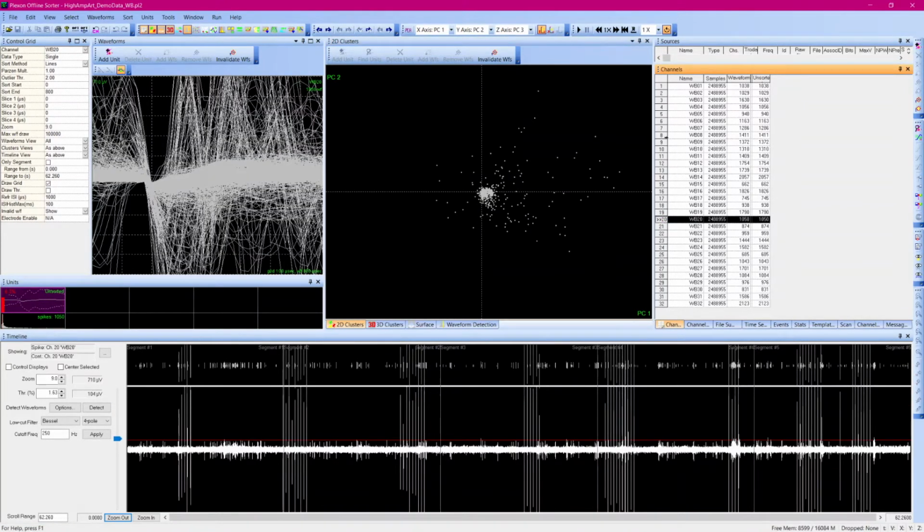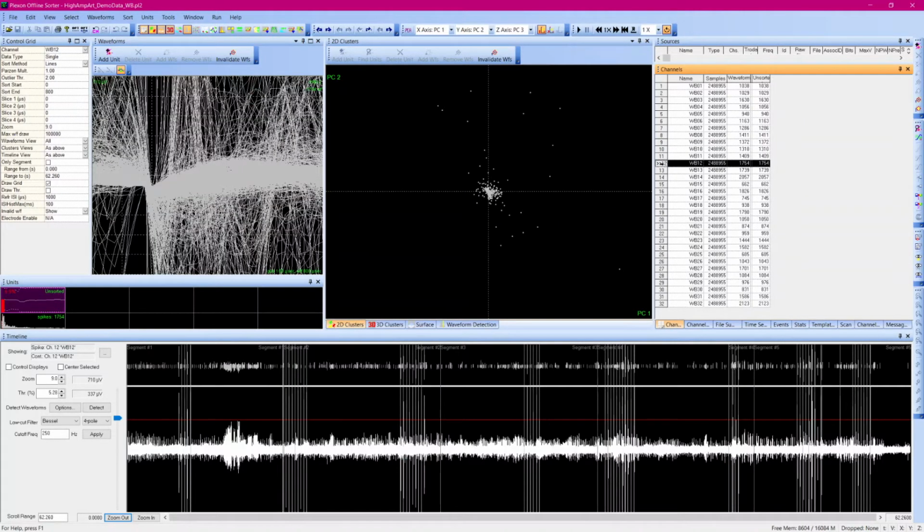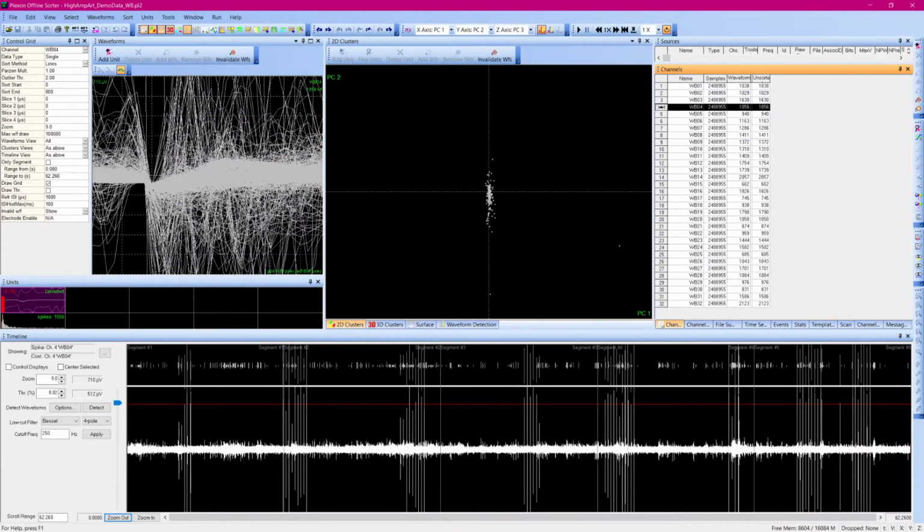Exploring across channels, these artifacts occur at the same time, but the amplitude varies somewhat across the channels. To get a sense of the overall amplitude, I will look at the range, shown here on the left beside the Y-scale zoom, and I will use the threshold cursor to approximate the range of the signal data. As long as I do not push detect, changing this threshold slider will not affect the waveforms. The threshold slider option will only be available when continuous data is displayed in the timeline view.